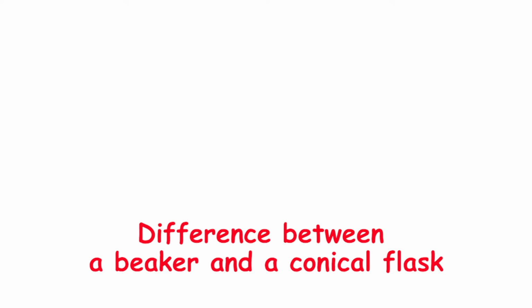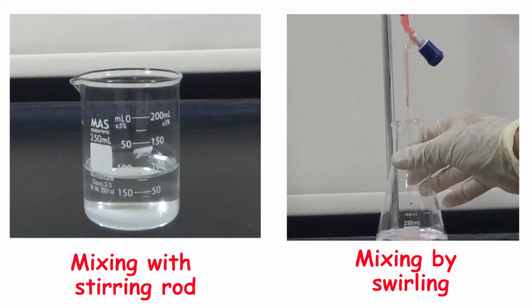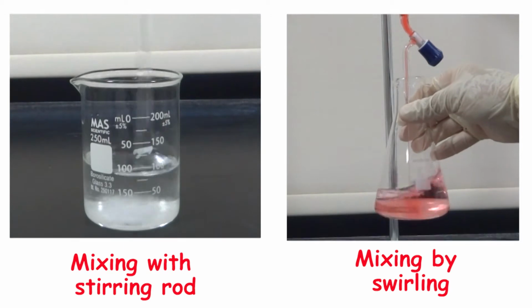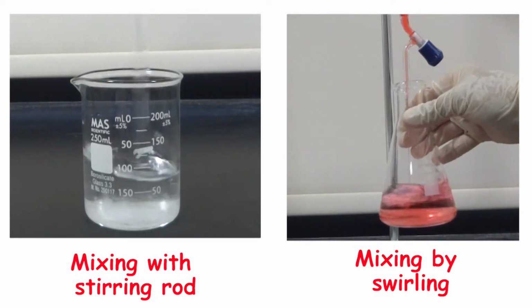Both a beaker and a conical flask are containers. When do we use each? A beaker has a wide top, while the conical flask has a narrow neck. In a beaker, mixing needs a stirring rod, while in a conical flask, mixing will take place by swirling.